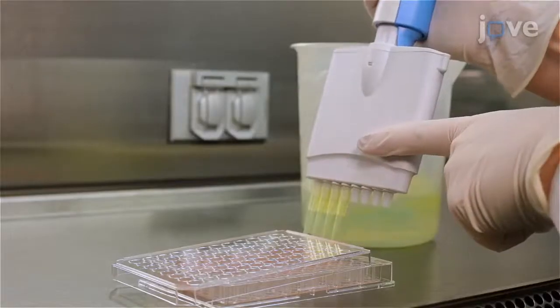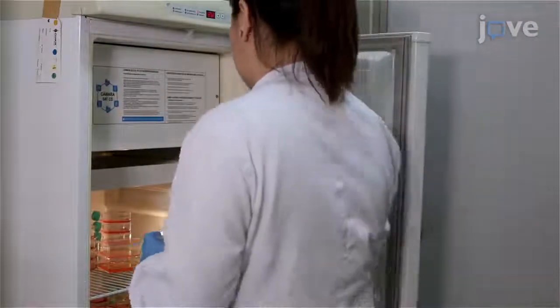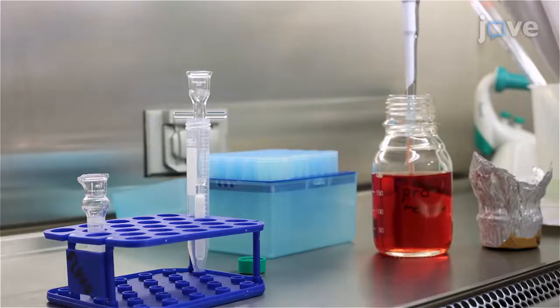This protocol is suitable for studying Leishmania virulence because it provides a systemic view of the vertebrate host to the cutaneous infection. The main advantage of adopting this protocol is that it allows researchers to evaluate the host inflammatory response and parasite replication simultaneously. This method can be used for characterizing several targets and treatments related to virulence, which could bring you insights into cutaneous leishmaniasis control.